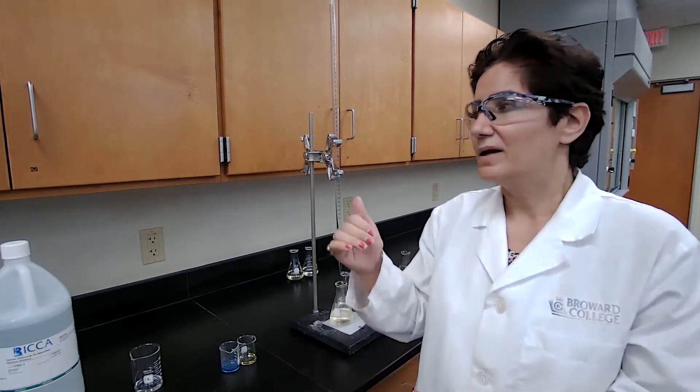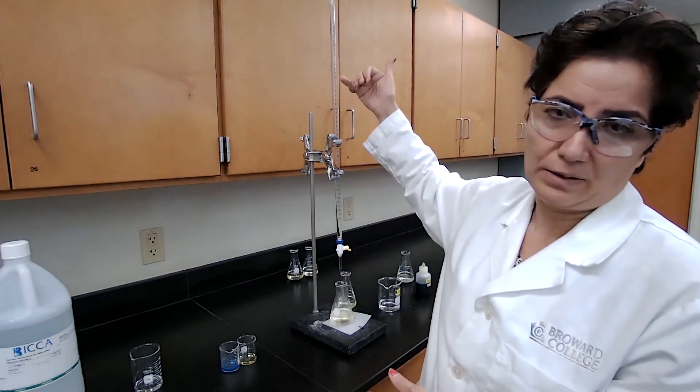If you use higher concentration of calcium chloride, this number might be more significantly different. But the idea and the theory that common ion is affecting the solubility and it will reduce the solubility is kind of observed based on the result of this experiment.